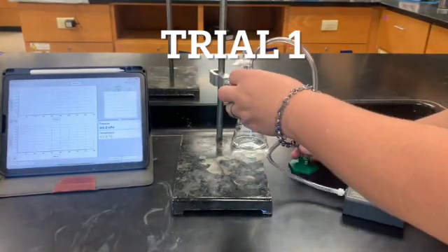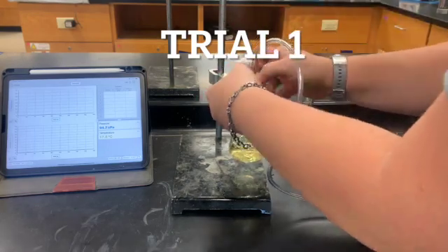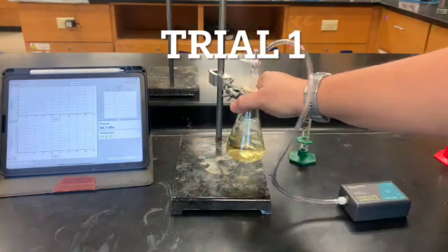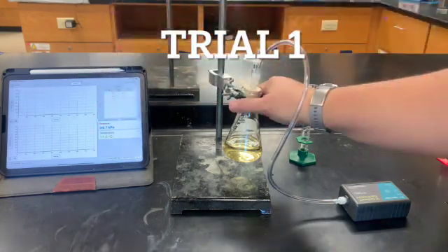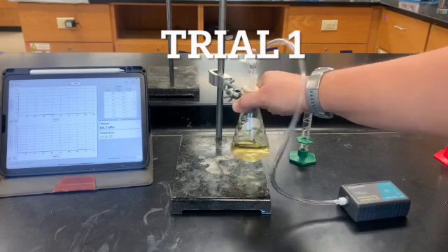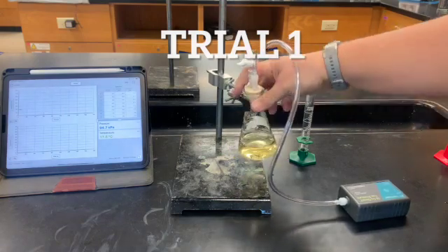So we're going to, this is closed. I'm going to pour it in there. I'm going to seal it. And we're going to let that reaction go and keep mixing it.